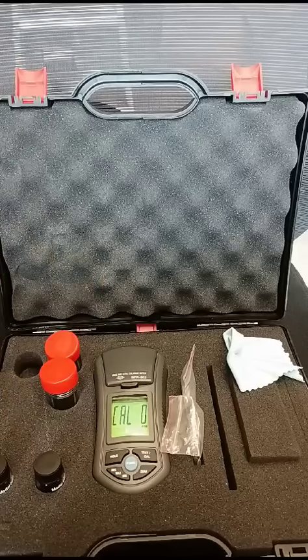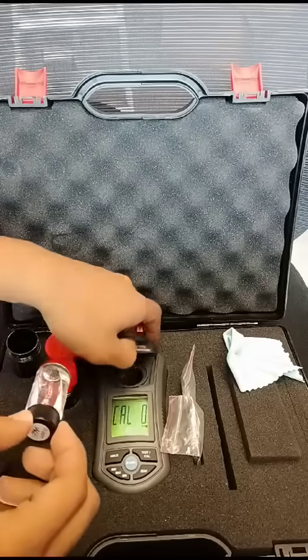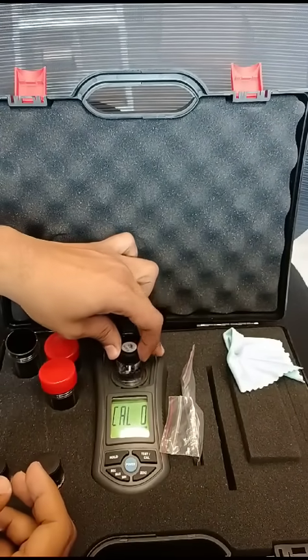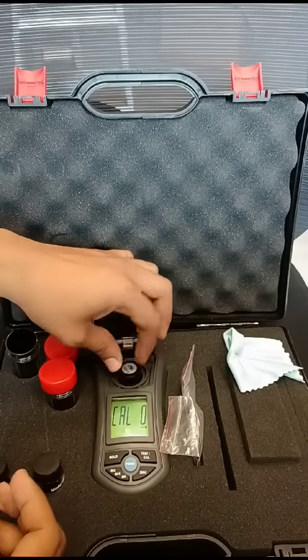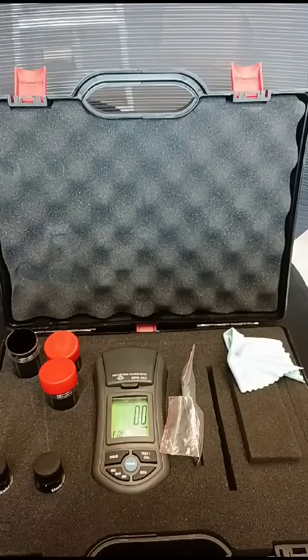Okay, now I should put in the zero standard solution. Make sure the mark is at the line here, and then press zero to remove all non-zero values.